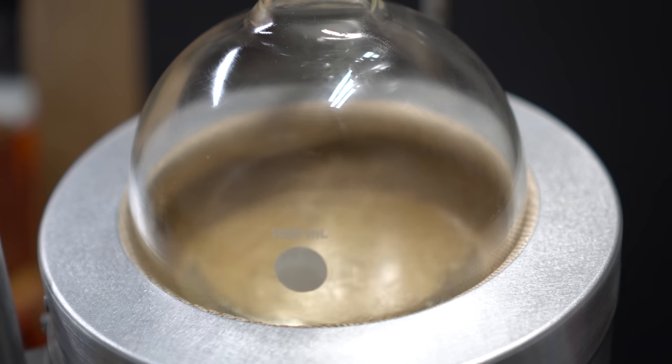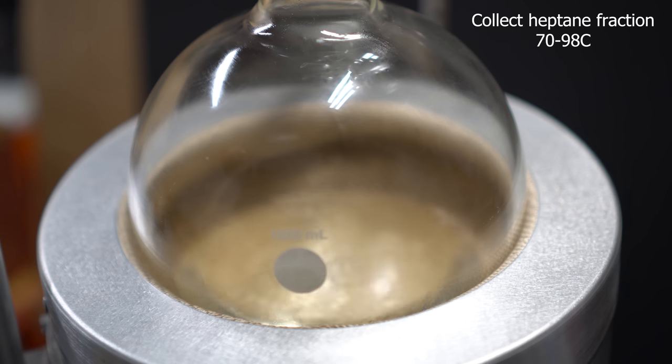The second that the temperature reaches 70 degrees Celsius we are going to switch the flask and you can also see that the boiling flask is boiling.